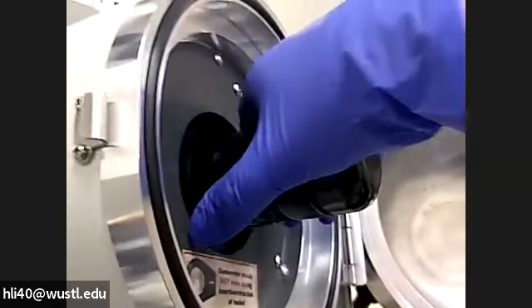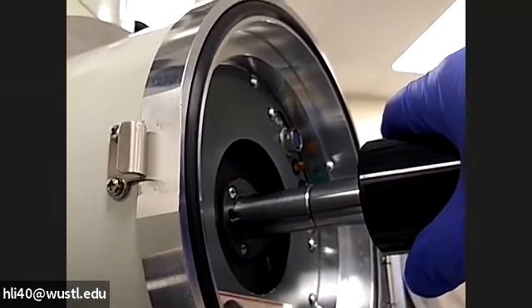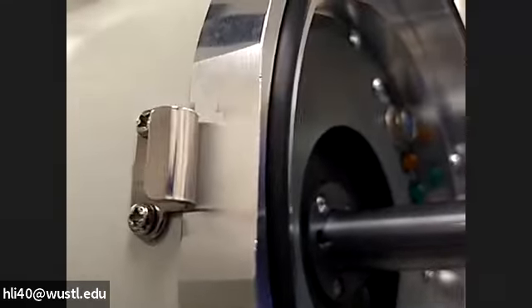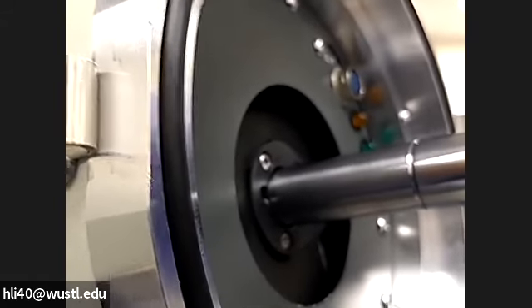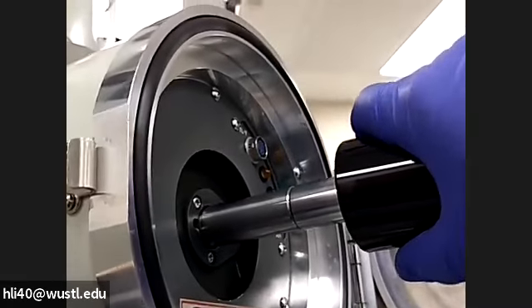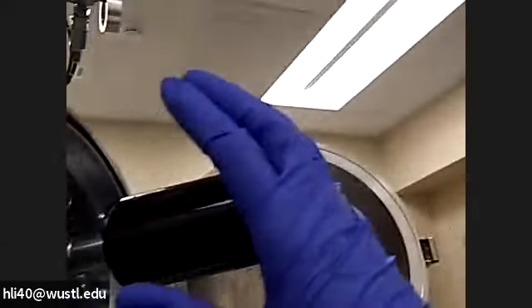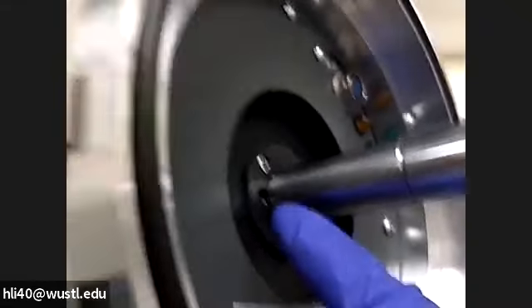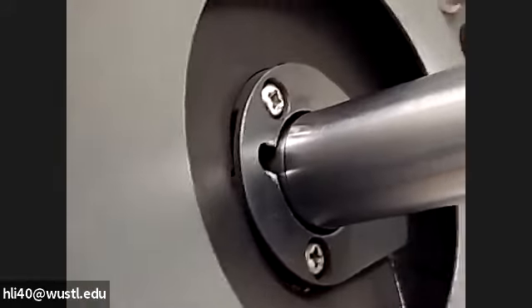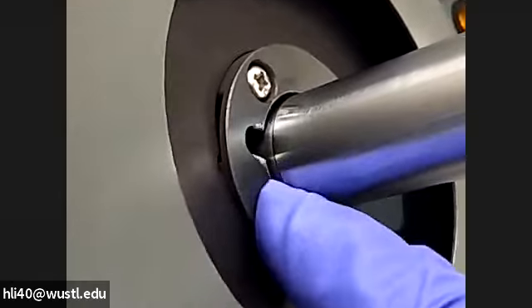So I'm going to do it. It's pull — straight, no tilting — until you cannot pull. It's a little bit heavy. You will see a little bit of line there. Now I'm going to rotate. When I cannot pull any more, I rotate, until I cannot rotate. After I rotate, move your hand away from the holder so that you can adjust your hand position for the next step. The first pull-rotation will bring the sample holder to this place. You see this line is right about the opening mouth of the goniometer.